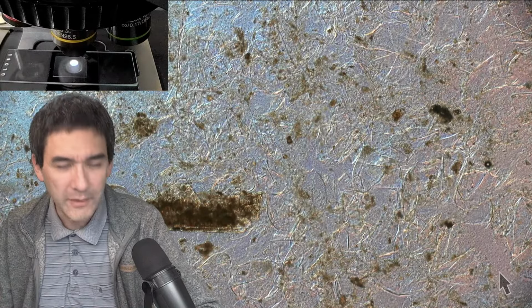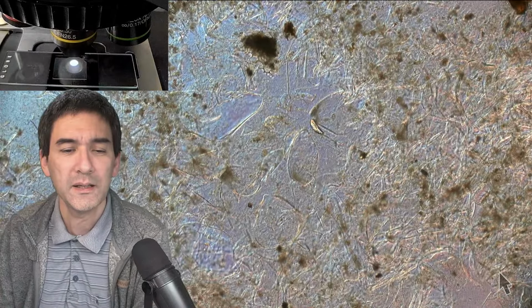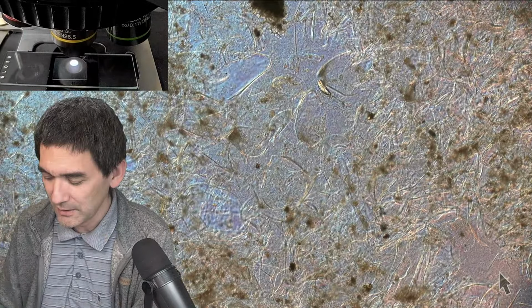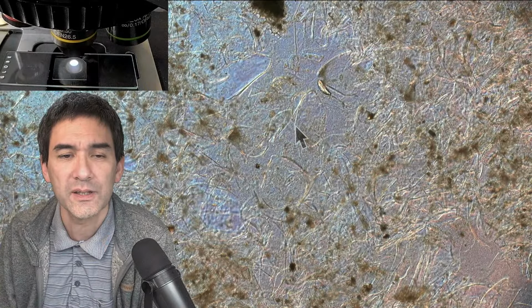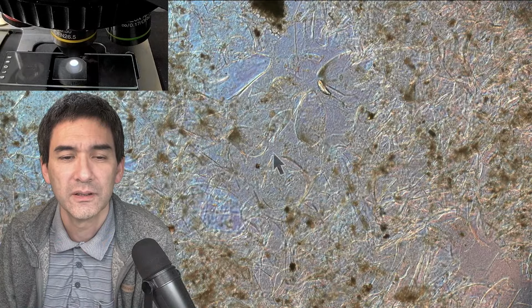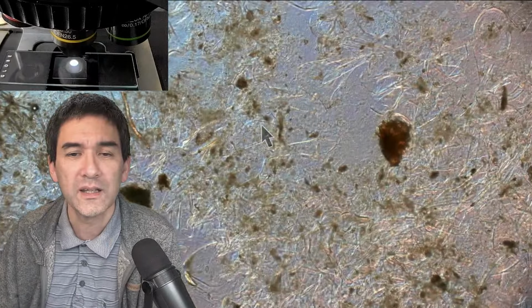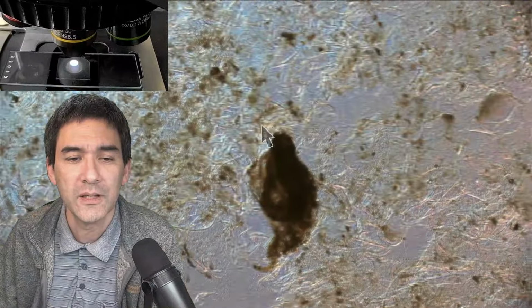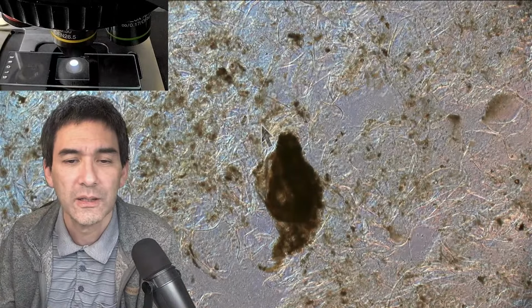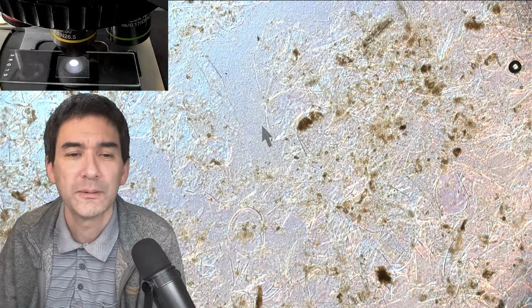Apple, strawberry, and banana. But for those of you who have not seen this yet, of course we can see cells, right? The cells are over here. So I already know what the next thing is that I would like to do. Of course, we want to find the xylem tissue. I don't know what this is here, but being a natural product, not surprising.